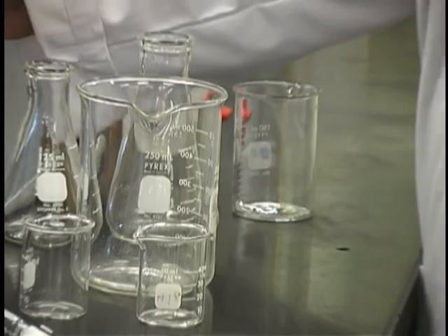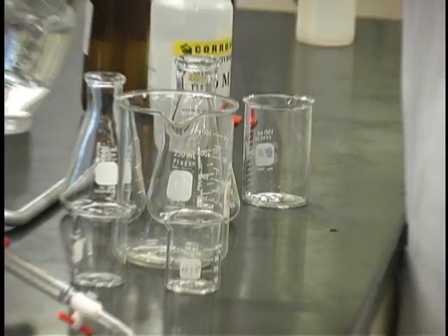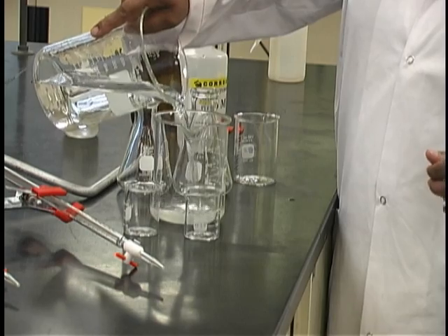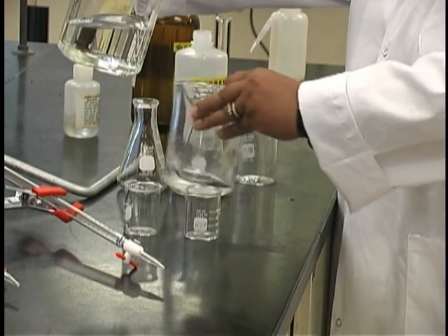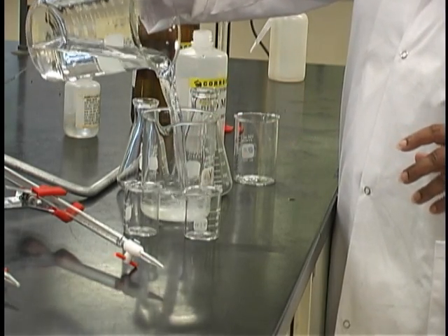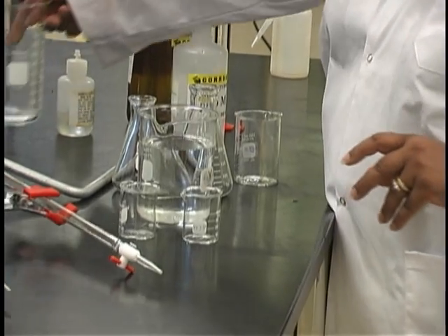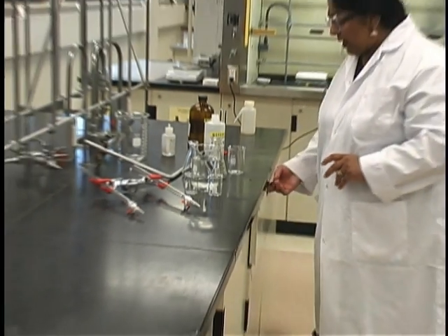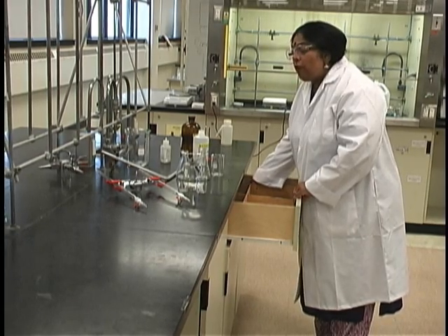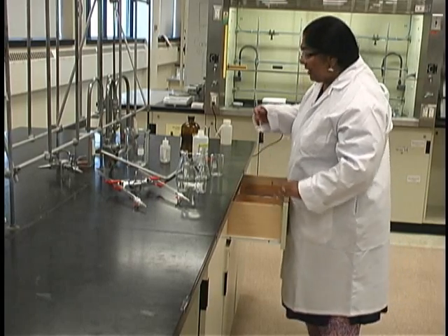Add between 450 and 500 milliliters of distilled water carefully to your 600 milliliter beaker. This will assist in diluting your base, but it's not a bad idea to swirl in between. Then obtain a glass stirring rod and stir your solution for at least two minutes to ensure that your solution is completely homogeneous.